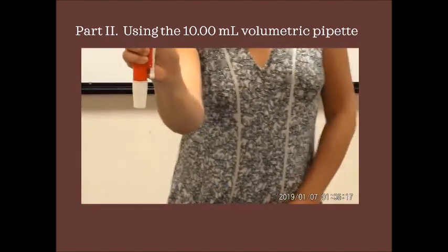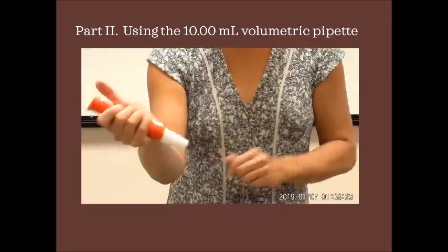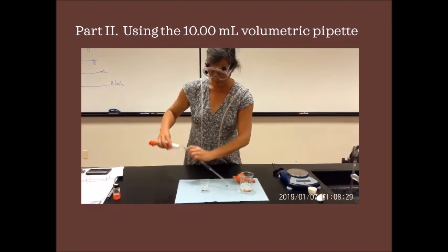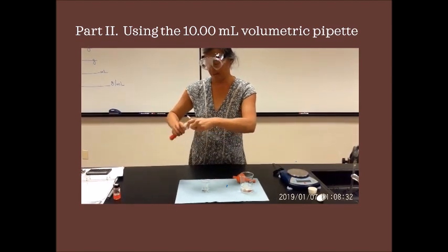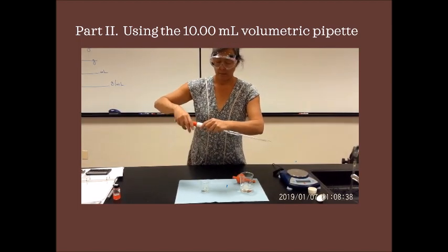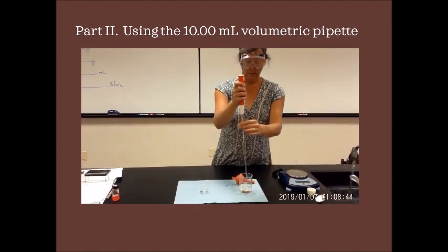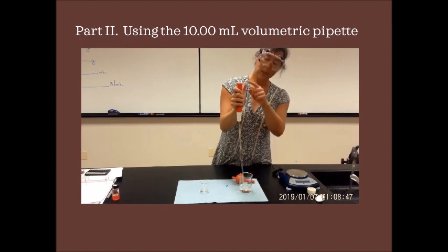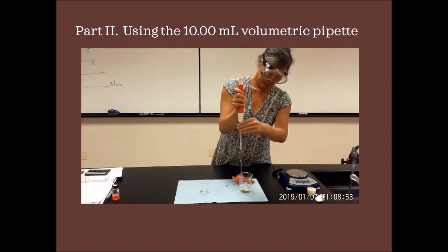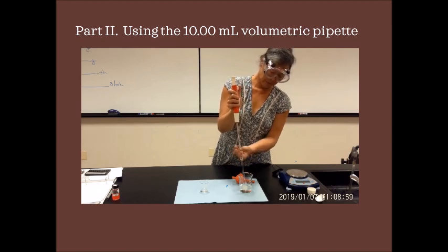If I push down on the wheel, it will start sucking up the liquid. If you loosen it, this makes it loose enough that you can fit in the tip of your pipette. Once you do that, you can tighten it, but don't over tighten, just finger tighten it so that it's snug. Put it into your solution, and as you push down on the wheel and this starts to come up, you should see that I'm pulling up my solution.